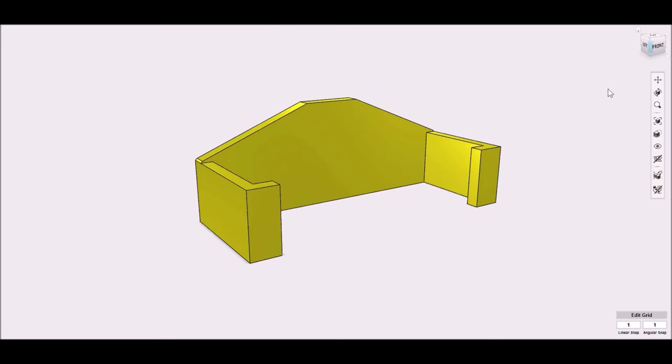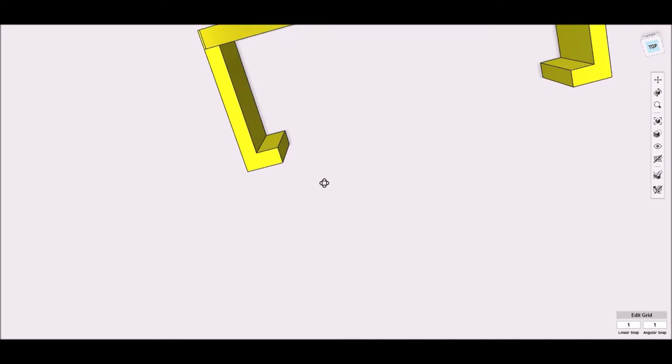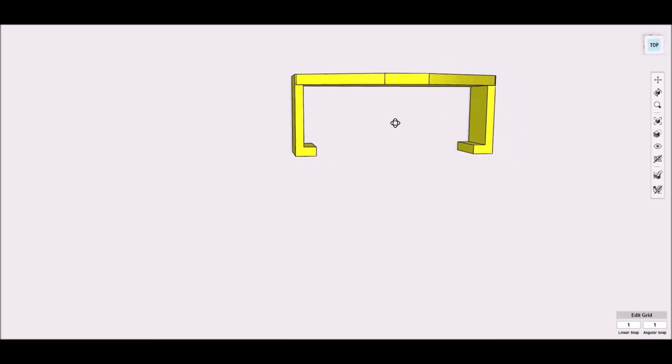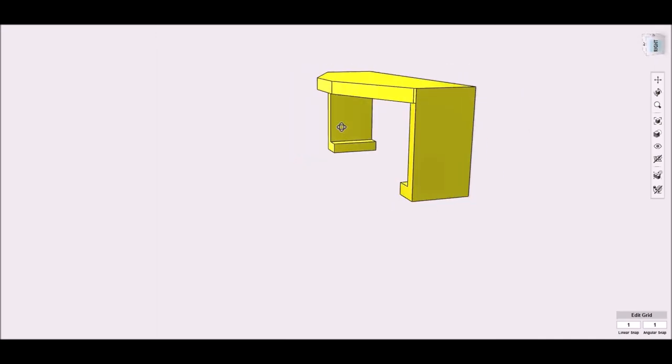This little bracket is just a spacer lock to prevent the main Raspberry Pi bracket from moving around. It could have been designed as part of the main bracket, but it wouldn't have printed without support. It would also allow for an easy reprint if I had the dimensions wrong. However, everything worked out on the first print, so it all worked well.